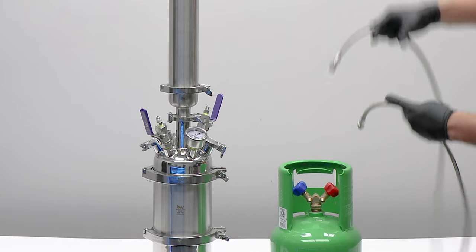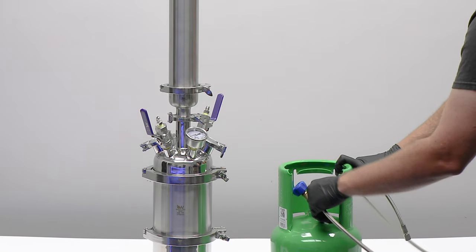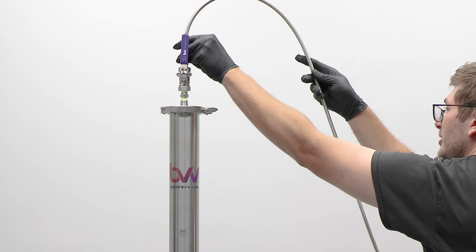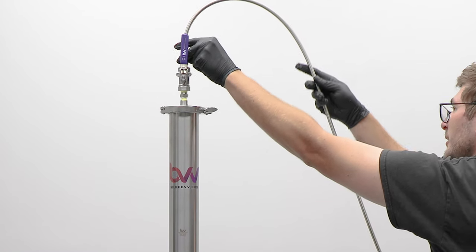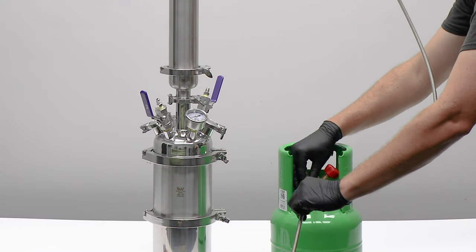We're going to attach the long one to the red valve for liquid withdrawal to the end cap on top of the column. The shorter of the two hoses will attach to the vapor inlet and connect to the extractor base.